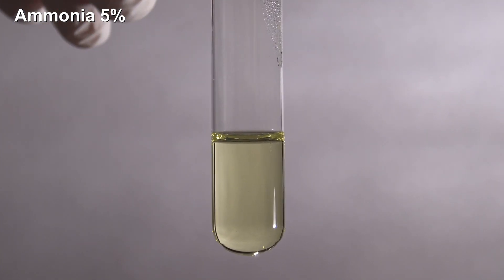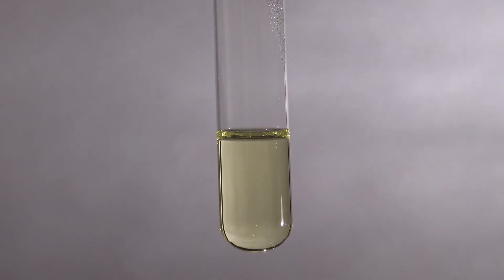Then, the sample is left to sit for a few minutes. When no precipitate is formed, more drops of ammonia could be added, as long as the nitric acid stays in excess.